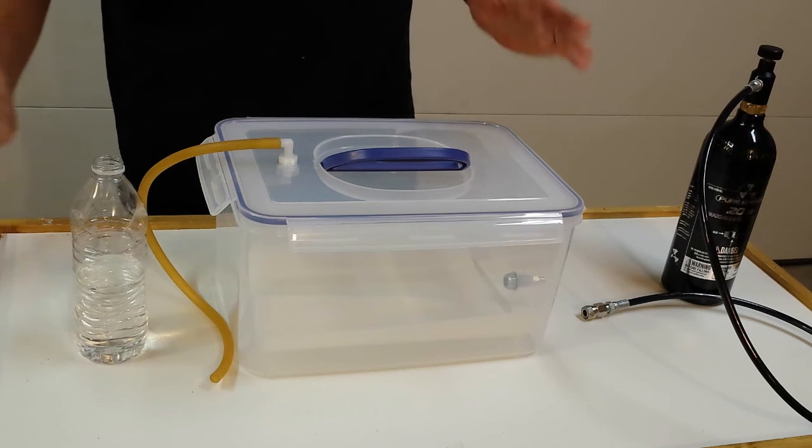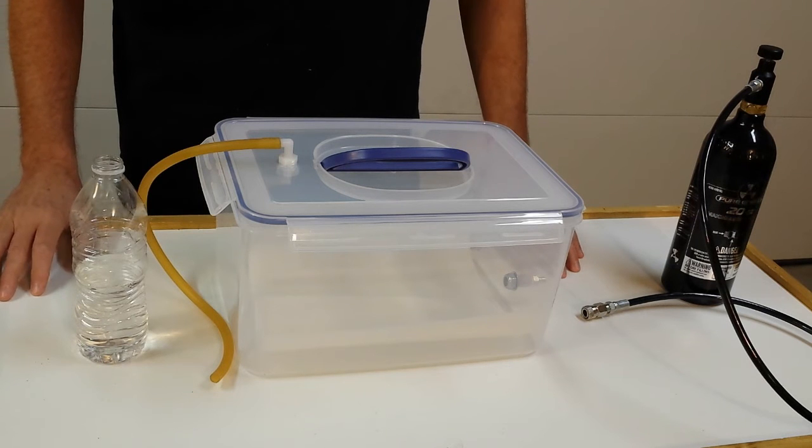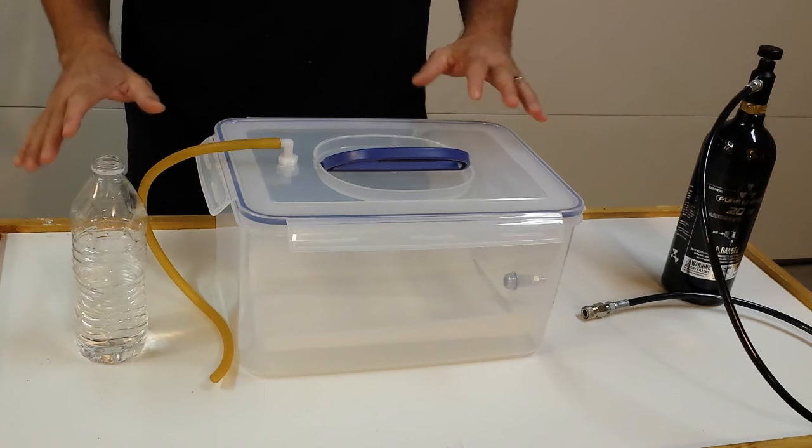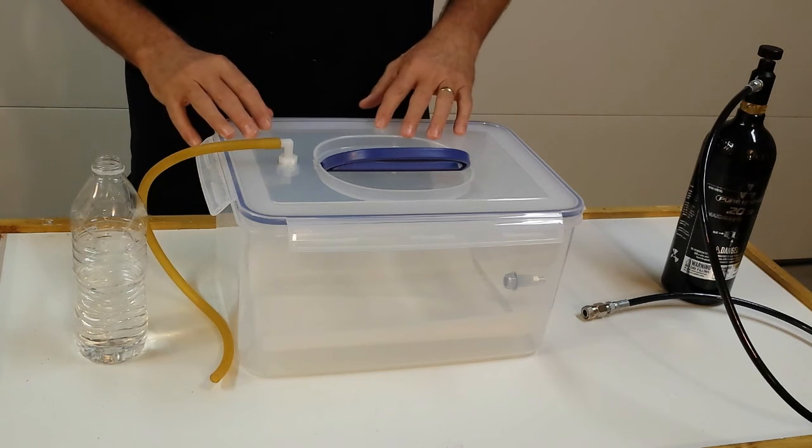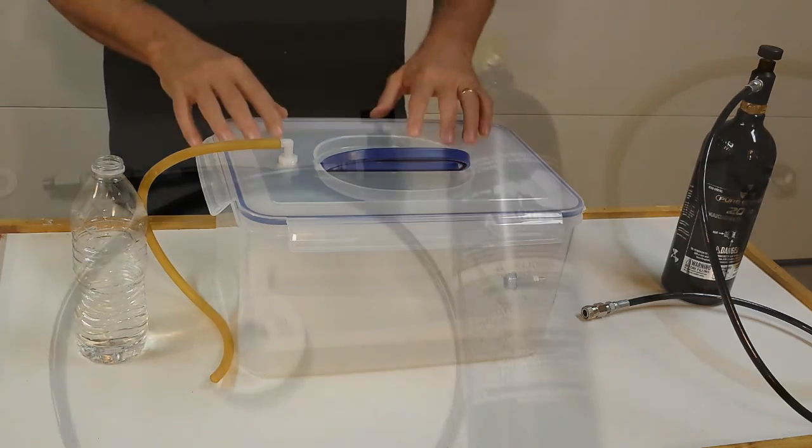So with all that said, here's the completed unit. Let me show you all the parts that I used, and then we'll come back to this.